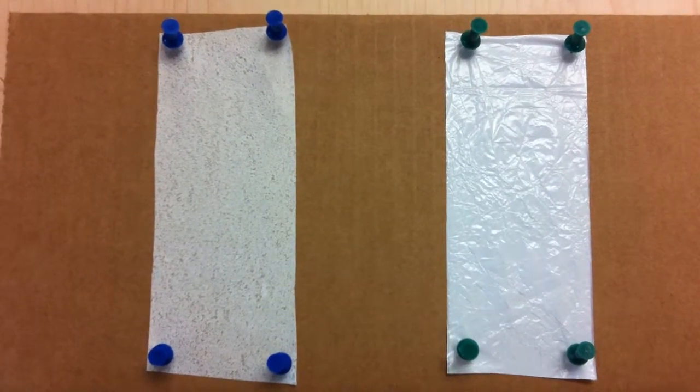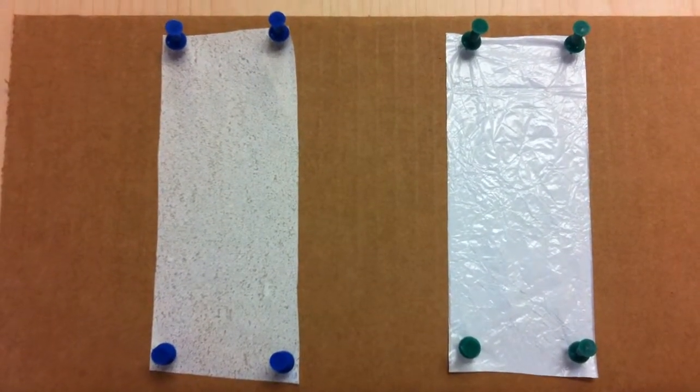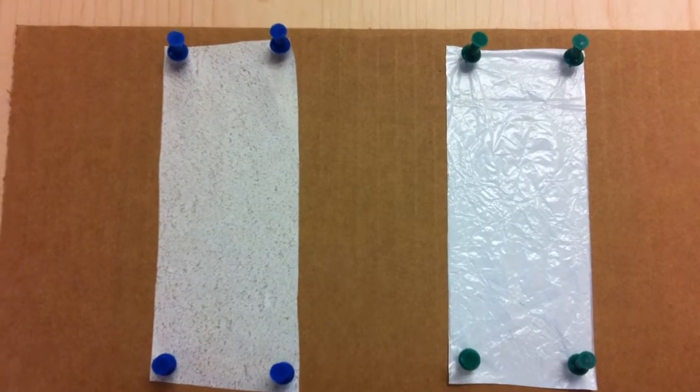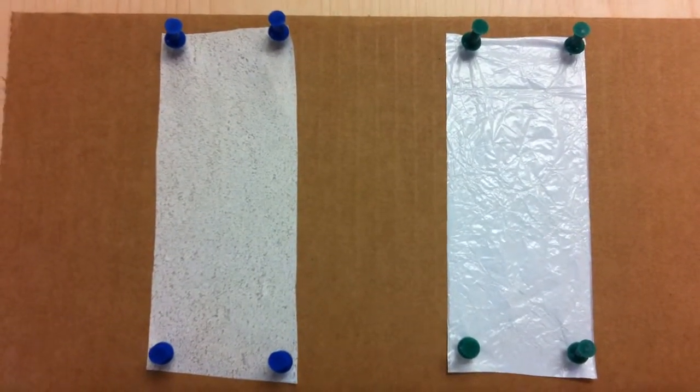Hello. We had a customer ask us once how well our material would wet out, so we thought we'd do a quick demonstration with food coloring, which is a polar solvent much like the electrolytes in lithium-ion batteries.